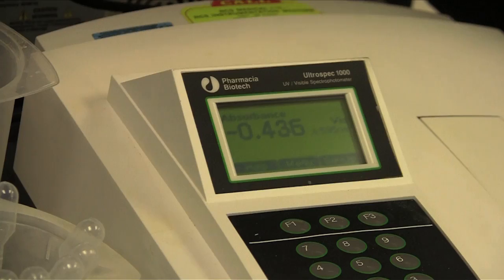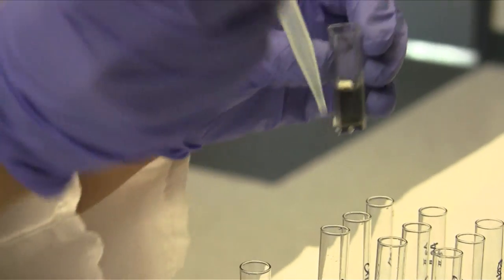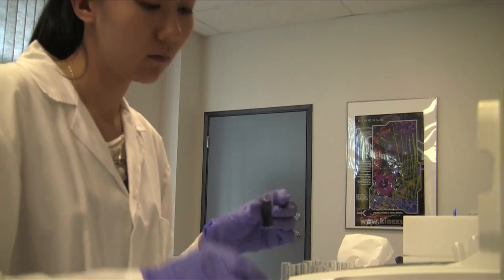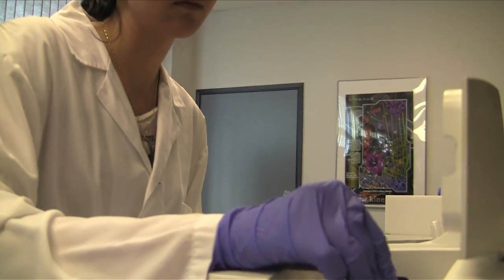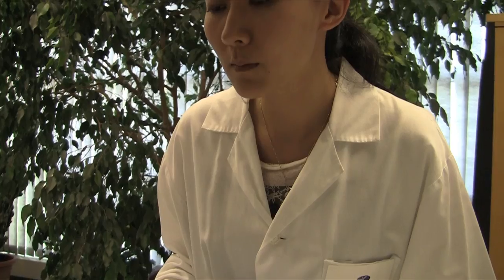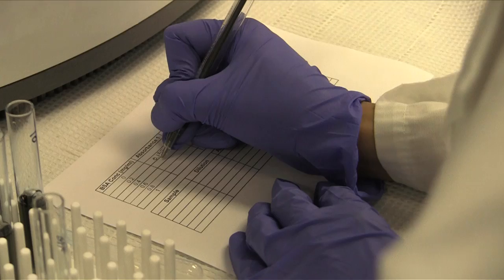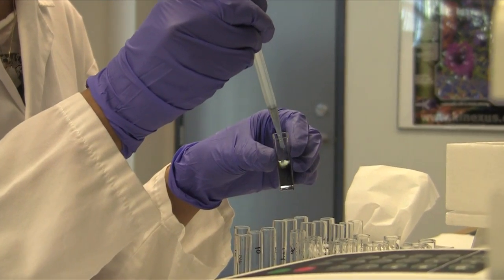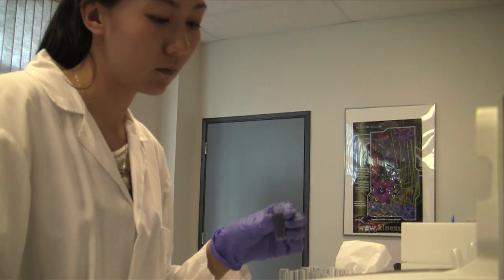Calibrate the spectrophotometer with a blank control that contains the Bradford stock reagent with 100 microliters of PBS. Record the optical density readings obtained for each standard and test protein sample. Keep the outside surface of the cuvette clean and moisture free.